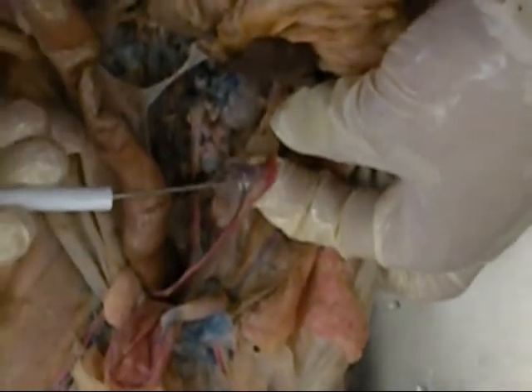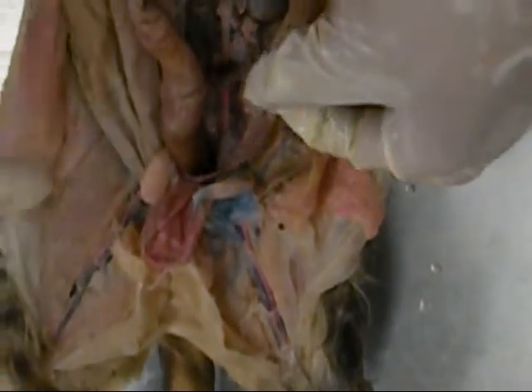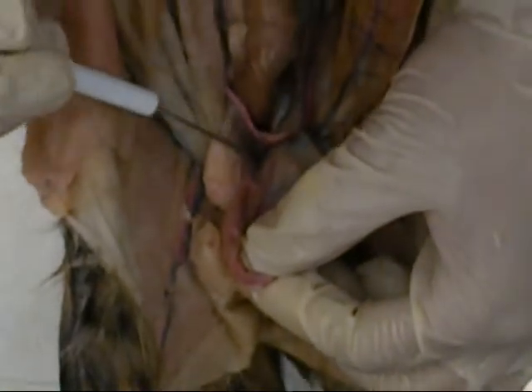The ovary, you can see, is the little knot here with its own blood vessels at the head of each area of the uterus. The uterus in the cat is a two-horned uterus. When we have the pregnant one in this class as well, you can really see that the kittens will pouch up individually down the length of each horn of the uterus. Posterior to the urinary bladder, where the uterus horns come together, we have the cervix. So the cervix, two horns of the uterus, and at the head of each horn, the ovaries.